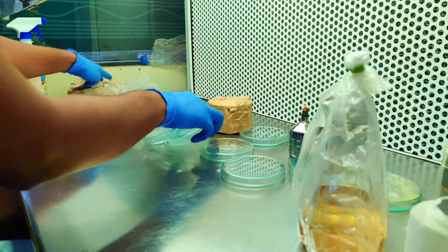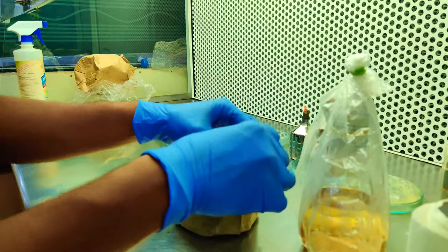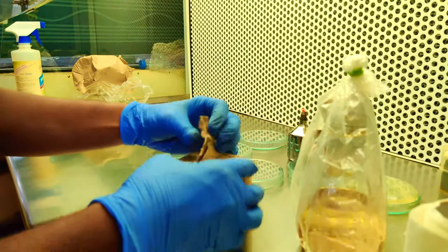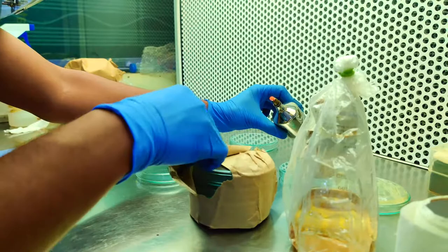This waste after usage you can put towards your left side, and whatever things you are using you can put towards your right. Before you unwrap, see how your spirit lamp is firing off and then you can work properly.